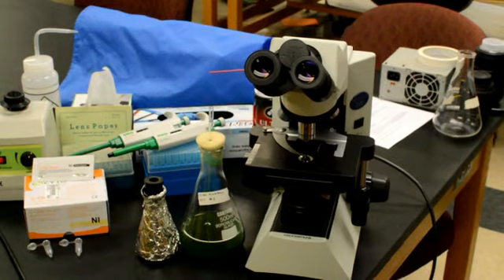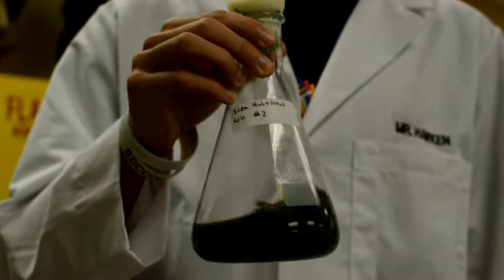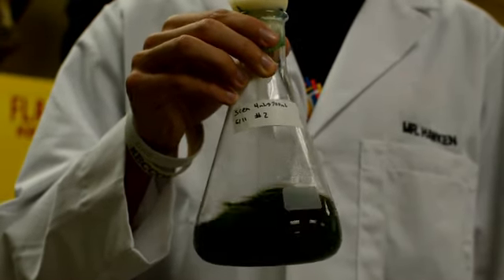In order to count your algae cells with a hemocytometer you will need the following items. You will need your cell sample to the correct dilution. In order to determine your correct dilution please click on the following link.